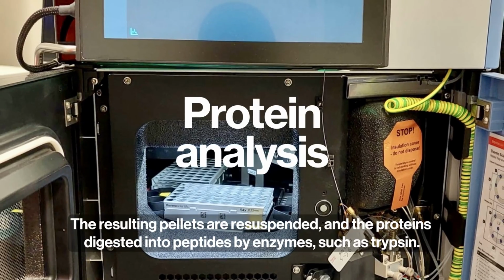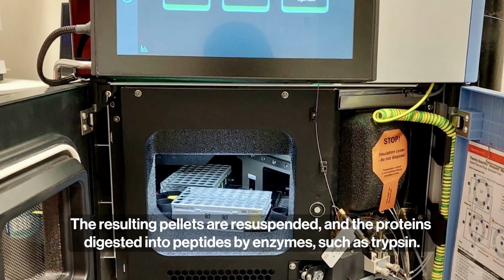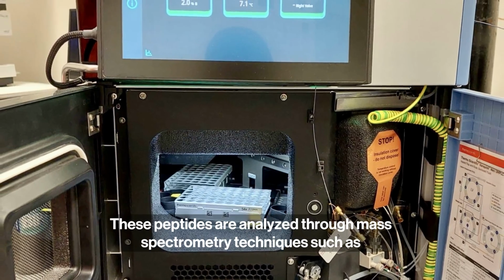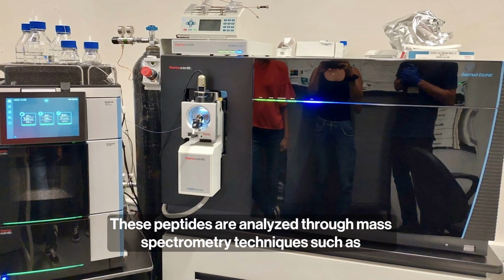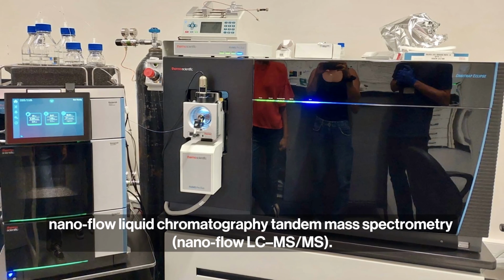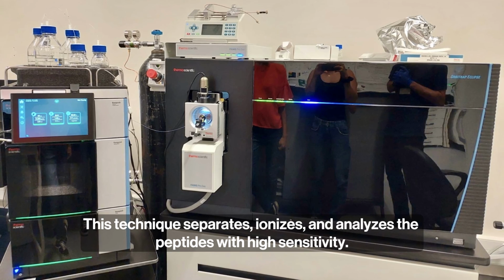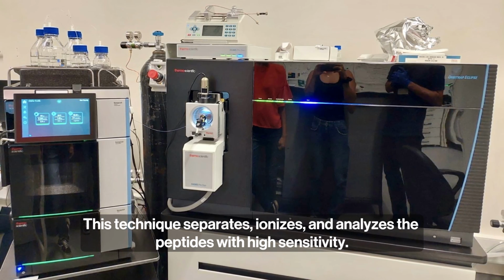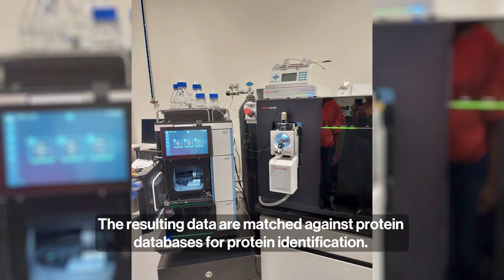The resulting pellets are resuspended and the proteins digested into peptides by enzymes, such as trypsin. These peptides are analyzed through mass spectrometry techniques, such as nanoflow liquid chromatography tandem mass spectrometry. This technique separates, ionizes, and analyzes the peptides with high sensitivity. The resulting data are matched against protein databases for protein identification.